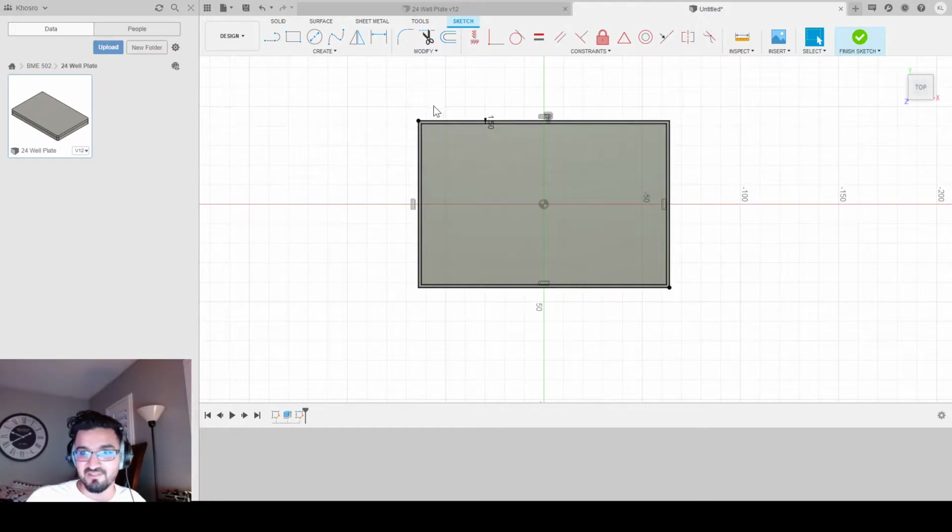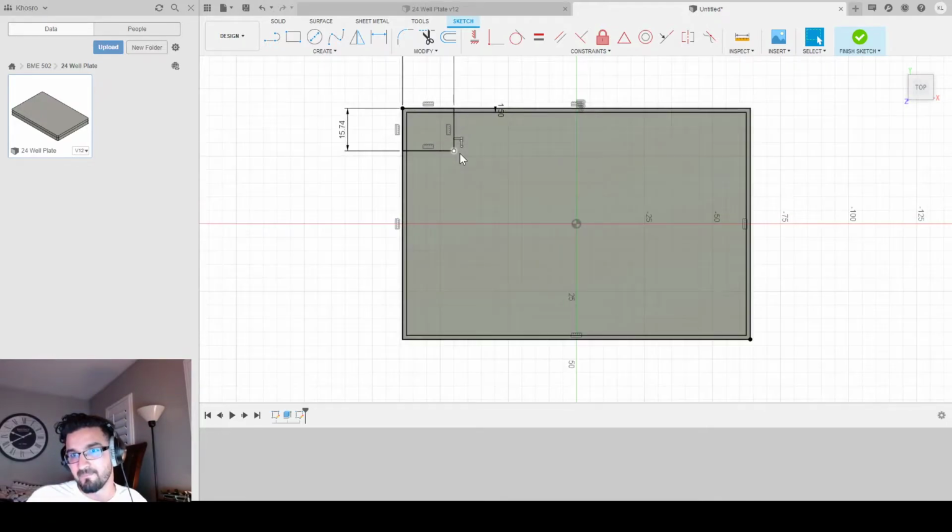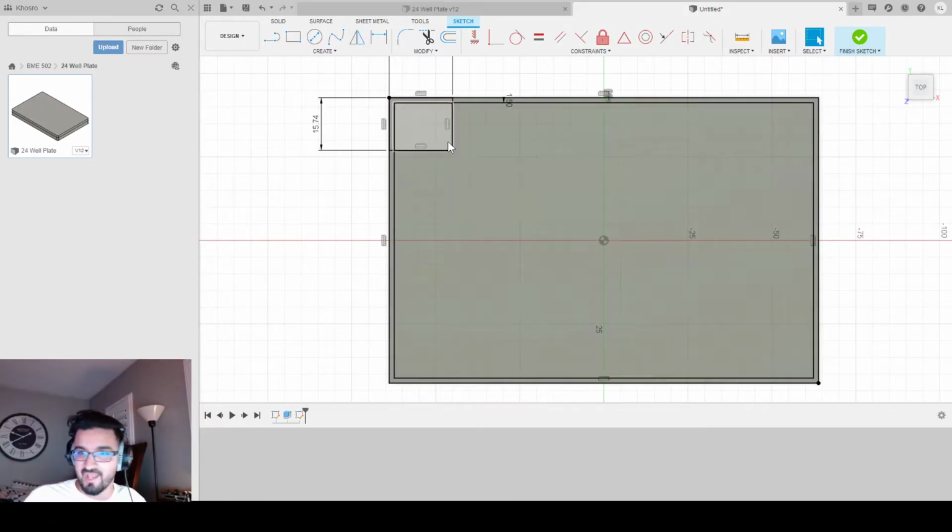I'm not done with the sketch though. I still need to essentially create an origin for where I'm going to place my circle. To do that, I'm going to create another 2-point rectangle, and my height is going to be 15.74 and my width is going to be 18.88, and that's going to give me an origin for the center of my circle to be at this point that I'm highlighting here. So I know my first circle, A1, is going to be over here in my 24 well plate.